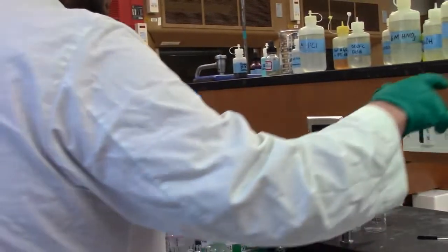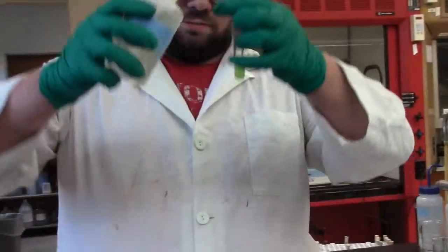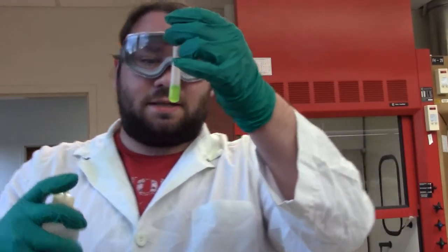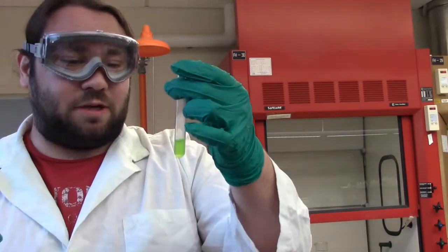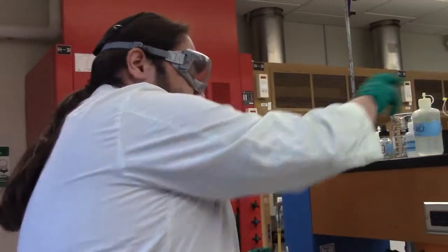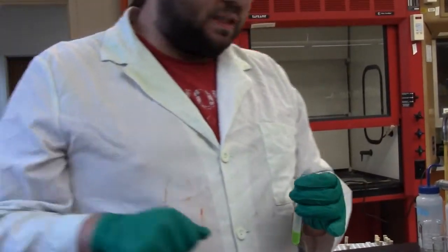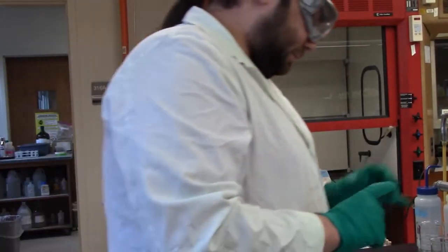And now I'll add some HCl. And hopefully it will become uncloudy. Yeah, this one doesn't look perfect on the video, I apologize, but take my word for it, we're pretty much where we want to be. So I'll do the next steps, and I'll separate the stuff, and I'll come back to you in a little bit. So hold on tight, and I'll see you momentarily.